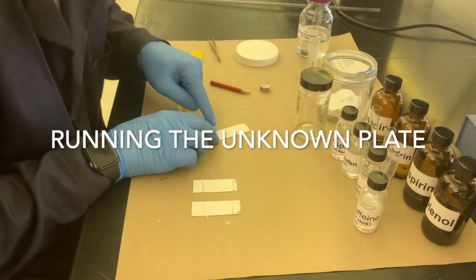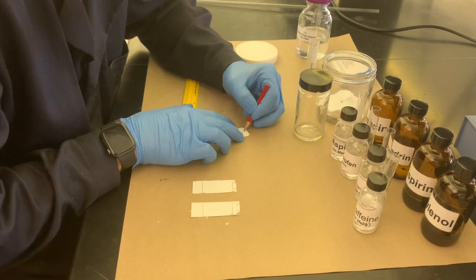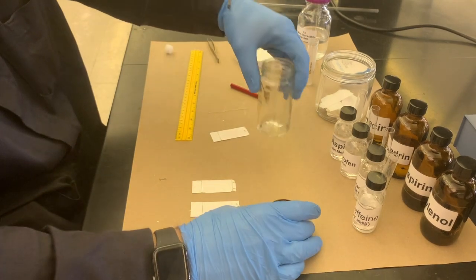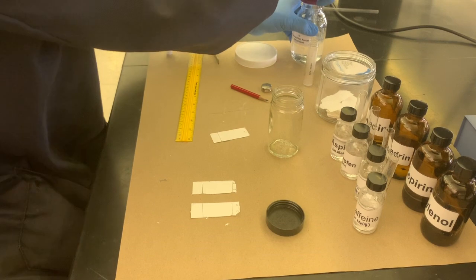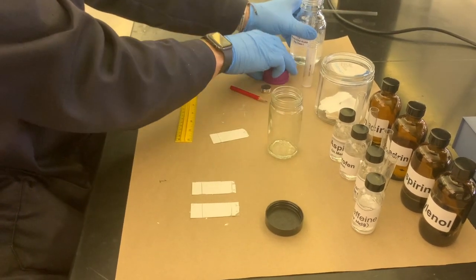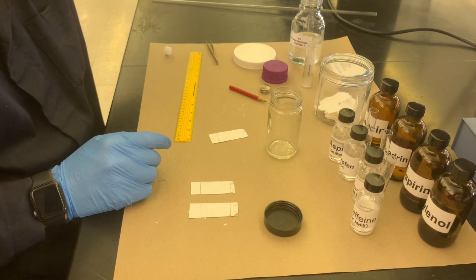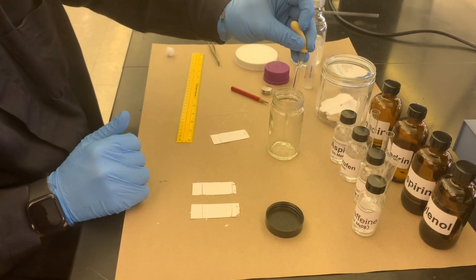All right, so we have the starting point. We're going to label this with a U and get it started in the TLC chamber. Once you get going and have everything set up here, it's actually a pretty quick process. It'll also make it a lot easier for us because you have only one sample going up only one plate. That's pretty useful if we're just using RF factor to identify our compounds.